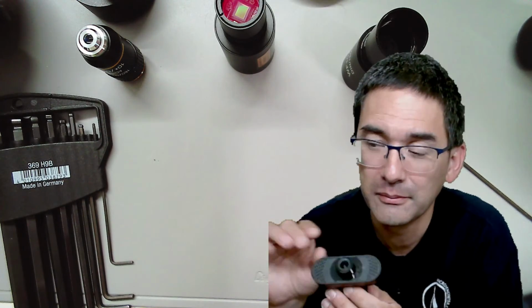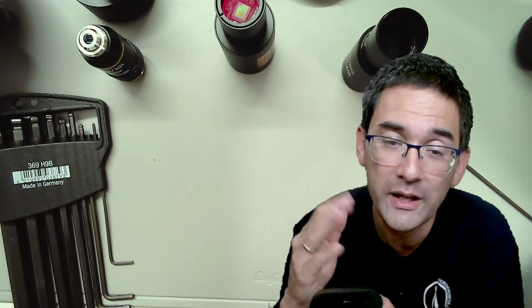And then later on, when the webcams came out, I took apart a webcam. Remember, 640 by 480, very low resolution. I also made myself a little webcam adapter. It was direct projection, but it was, of course, out of focus because it was too far out. So I always had to refocus, but it was fine because I only used the computer screen. And if it's not too far away, it's going to be fine.